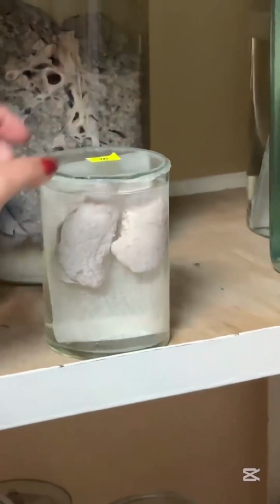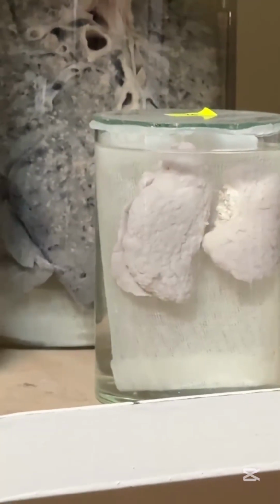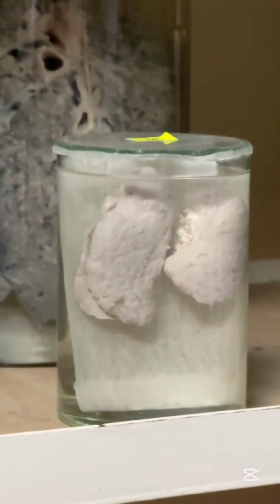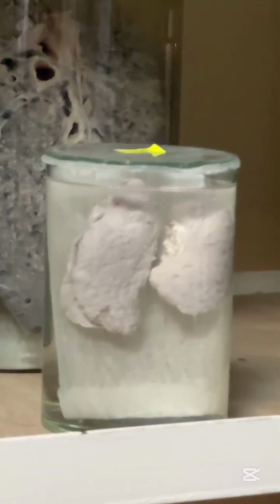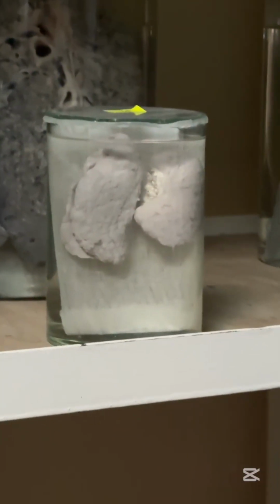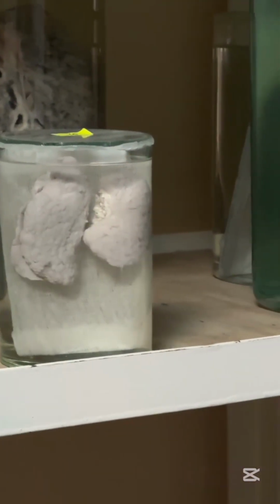Another. Nephrosclerosis. So you see two kidneys diminished in size, grainy surface because of hyalinosis and sclerosis of glomeruli and tiny vessel. That's why tiny scars. Maybe primary or secondary contracted kidney. If it is primary contracted, it needs vascular diseases like hypertension. If it is secondary contracted kidney, it may be due to glomerulonephritis. Nephrosclerosis. Let's go there.